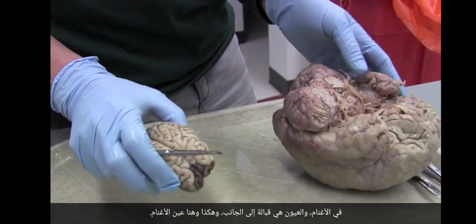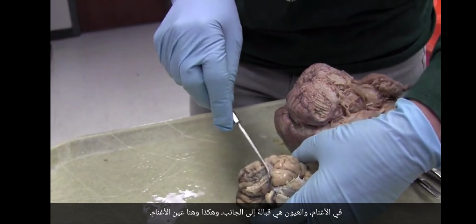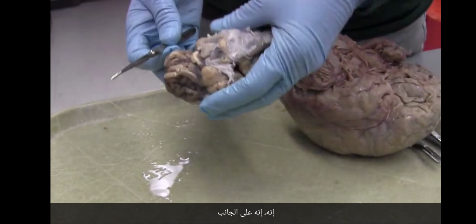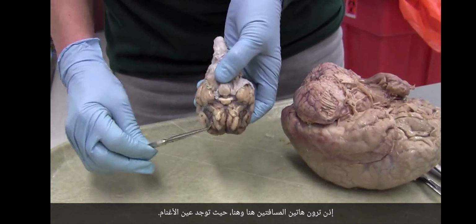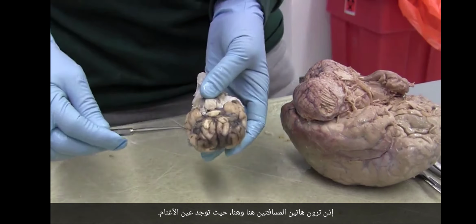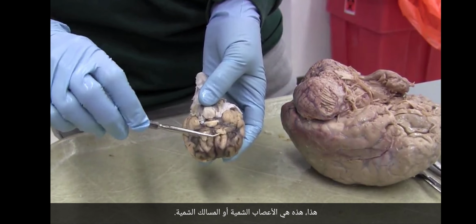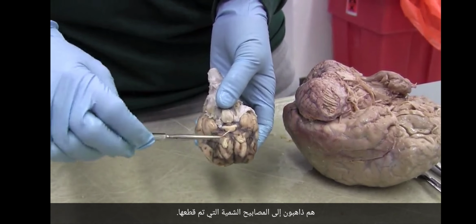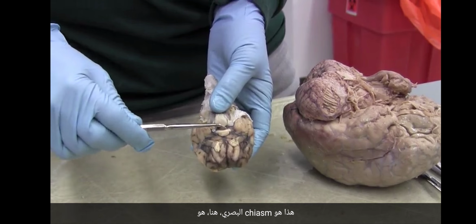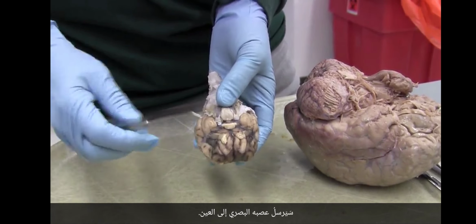In the sheep, the eyes are off to the side, and so here's the sheep eye. It's on the side. So you see these two indentations here and here. That's where the sheep eye is. These are the olfactory nerves or olfactory tracts that are going off to the olfactory bulbs that have been cut off. This is the optic chiasm right here that's going to send its optic nerve off to the eye.